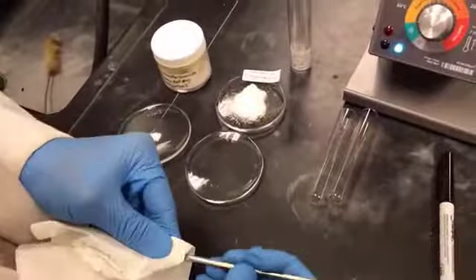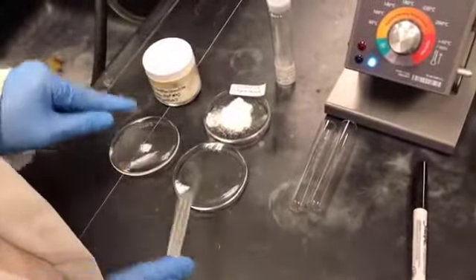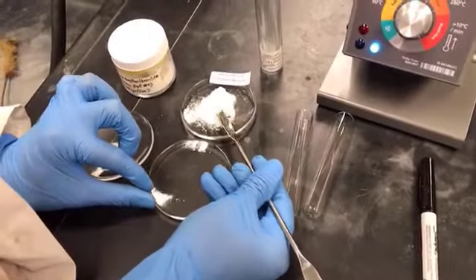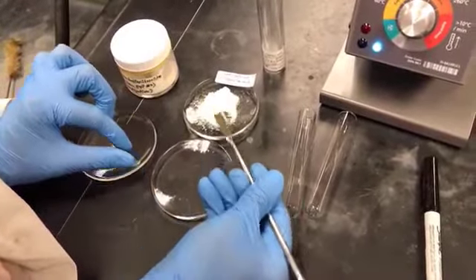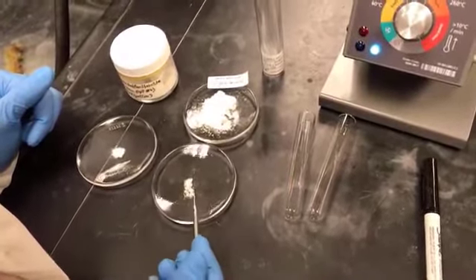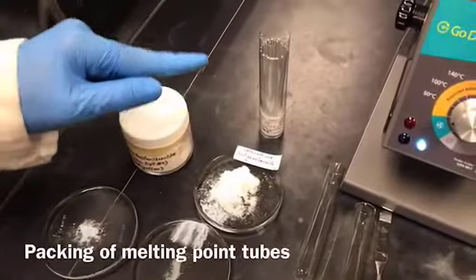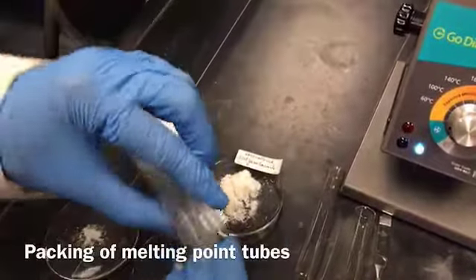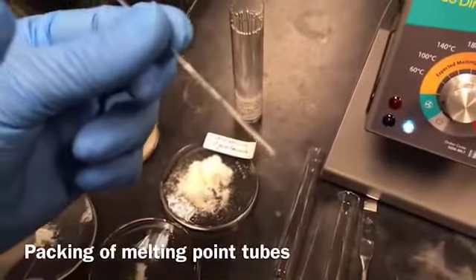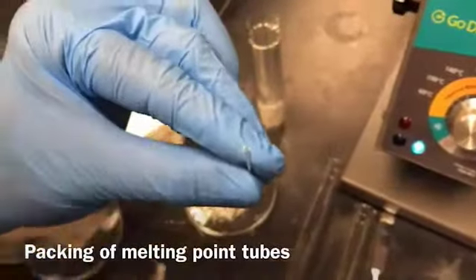You do not want any contamination of your pure sample, so make sure everything is nice and clean. Make sure your watch glass and everything is very clean. Then I'll take the pure crystals. So now it's time to fill the capillary tube, the melting point capillary tube. And they look like this. They are closed at one end, right? And they are open at the other end. So we are going to fill the sample through the open end.